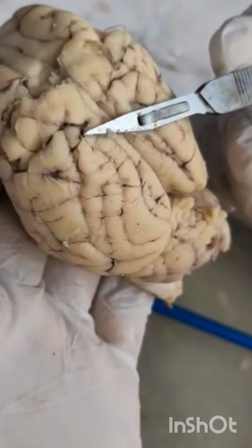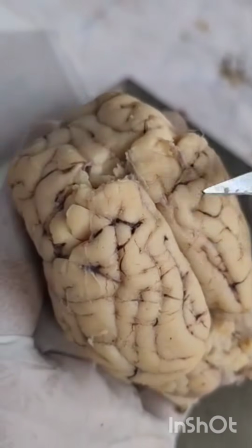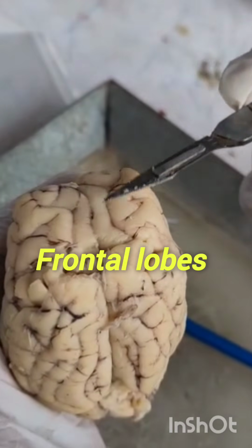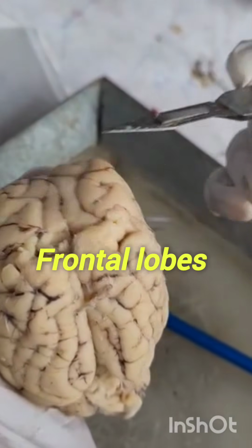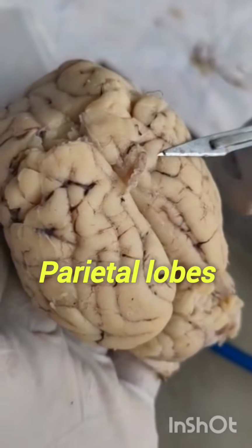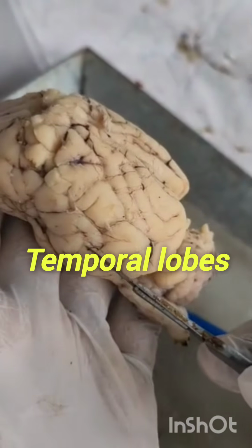And see, we know that the brain is divided into 4 lobes. This is the frontal lobe. These 2 lobes are called frontal lobes, and these are parietal lobes, 2 parietal lobes, and these side portions are called temporal lobes.